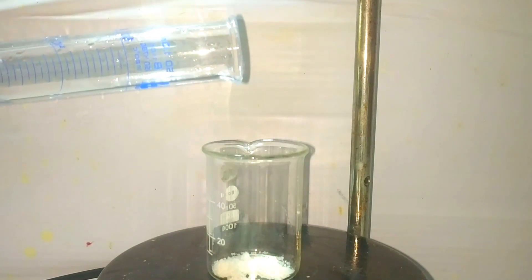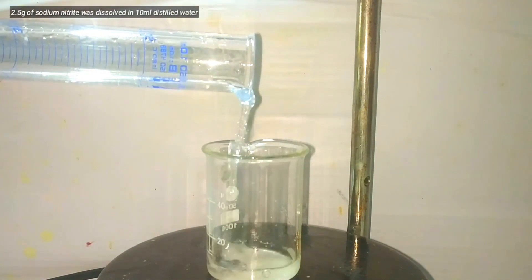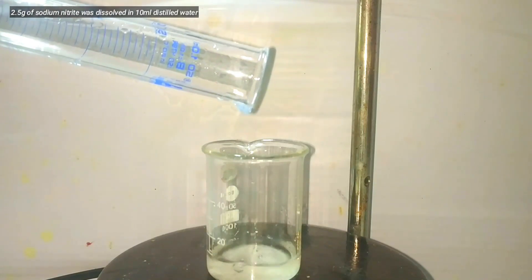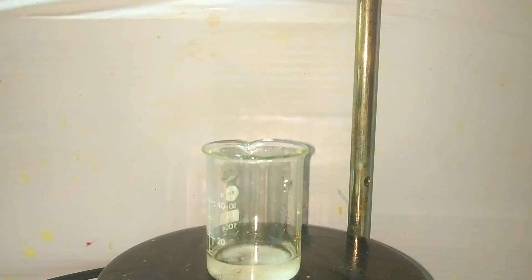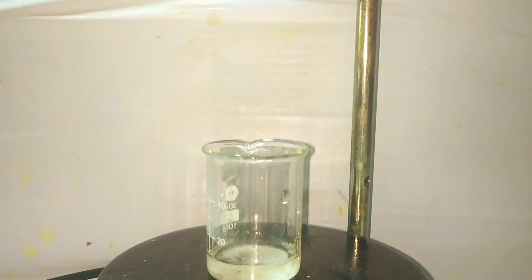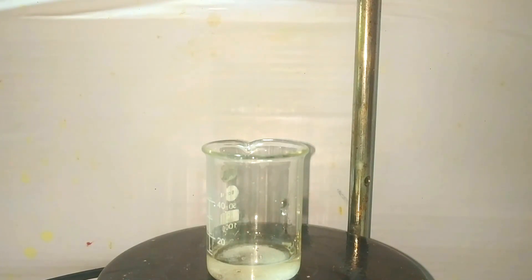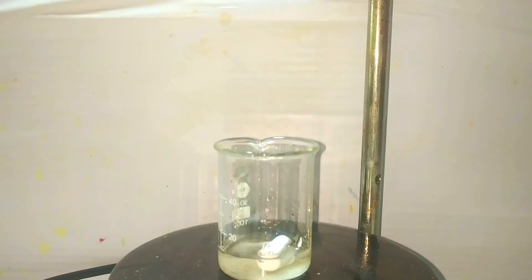Now a beaker containing 2.5 grams of sodium nitrite is placed on a magnetic stirrer and 10 milliliters of distilled water is added. A magnetic stirring bar is placed and stirring is started in order to dissolve the compound in water.